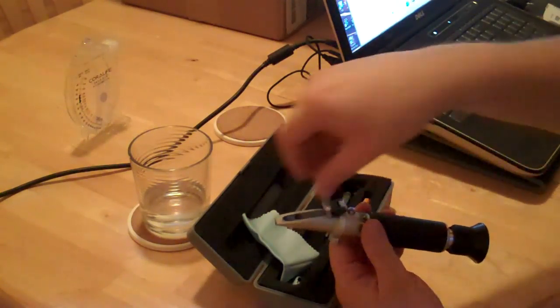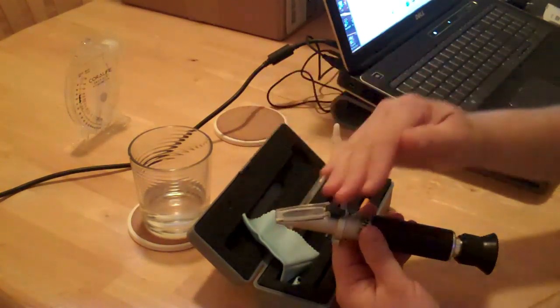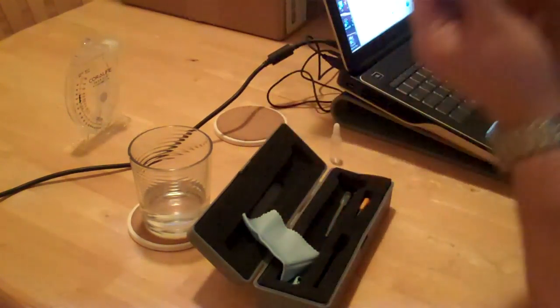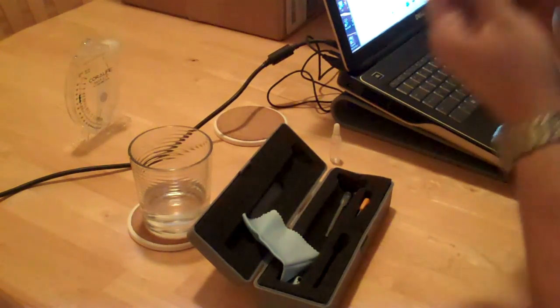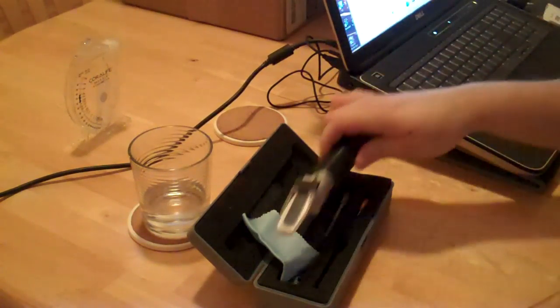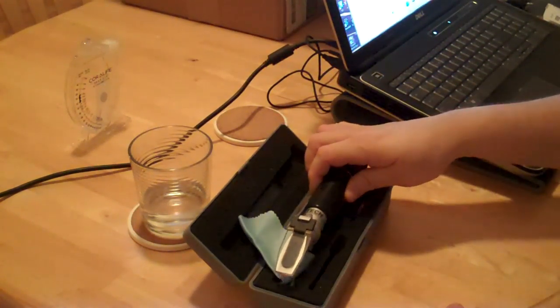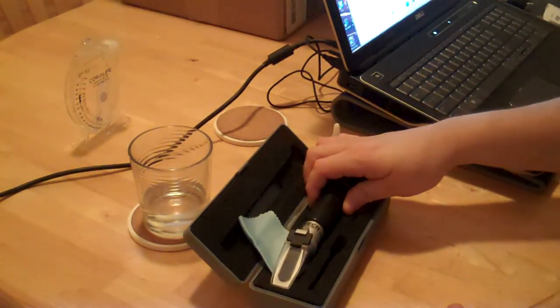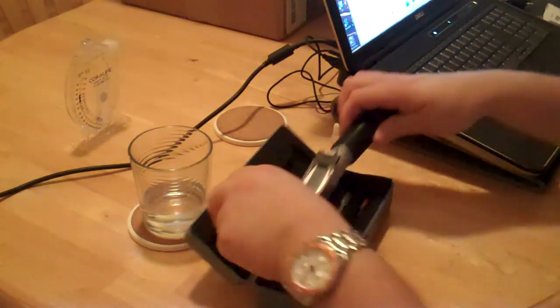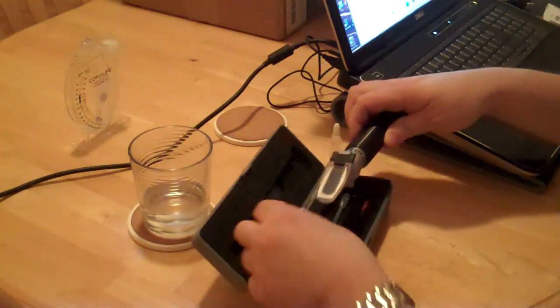Put the lid on, make sure it's even, and take a look. 1.026 is what mine just read. So it's right on.